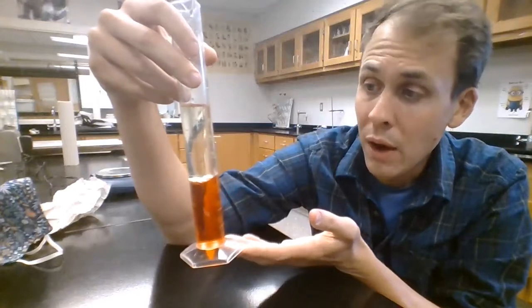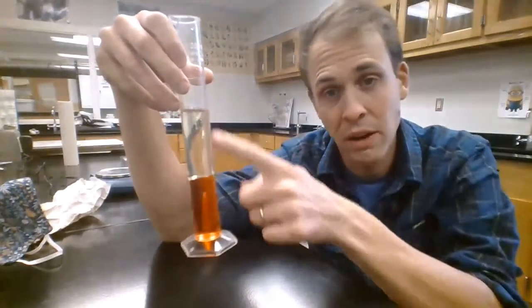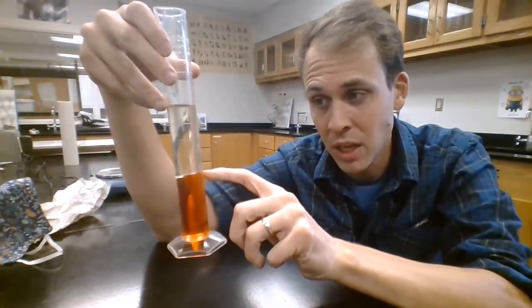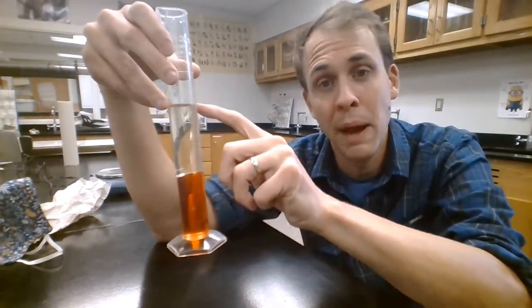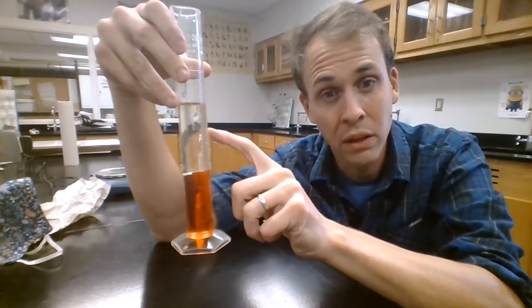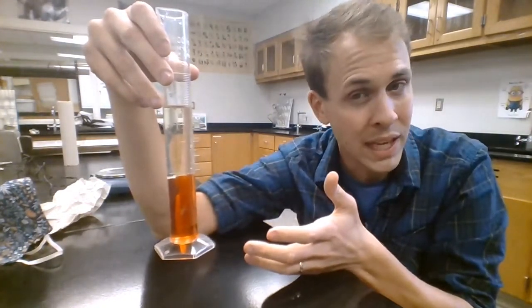I don't know the mass — I didn't record the mass of these — but I do have an idea of the volume because they're in a graduated cylinder. The volume of the red liquid is just under 40, and the yellow liquid goes from about 39 up to about 80. So I actually have slightly more of the yellow liquid and slightly less of the red liquid. I know something about their volume, and hopefully I can know something about their density.